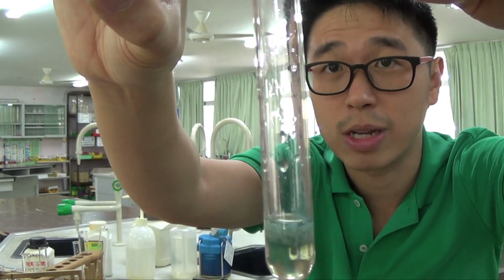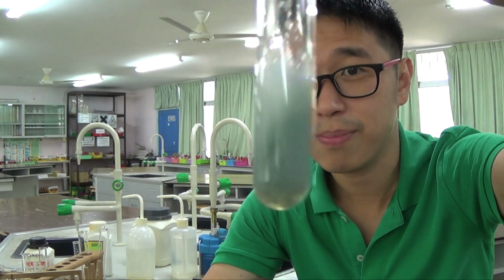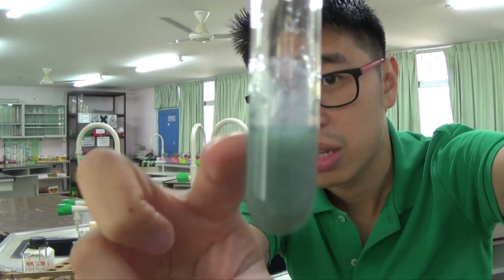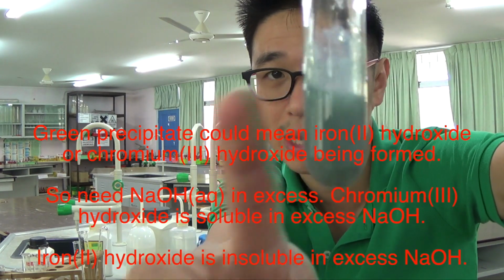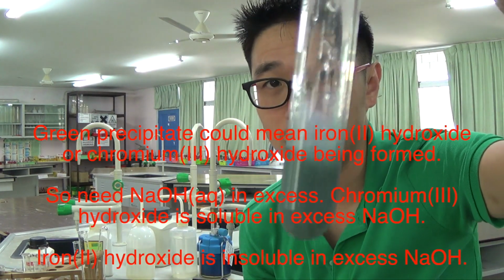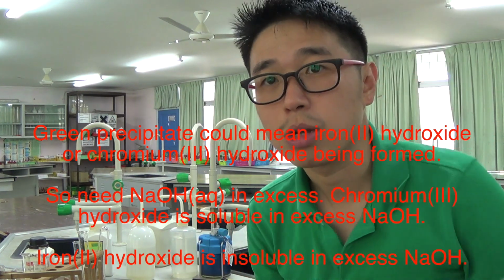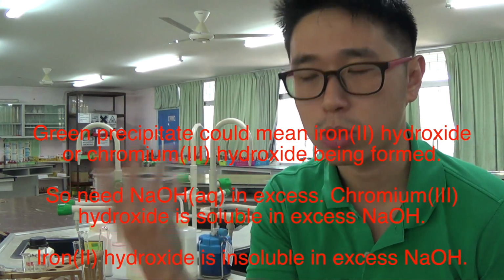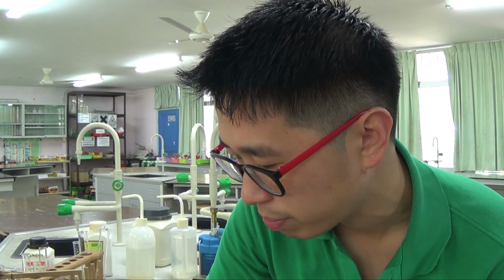Okay? So you should do it drop by drop and then you can see it. But I'm a professional, so I know what I'm doing. So you know what happens here. You get a green precipitate, like the color of my shirt, but a bit darker. Don't forget that a green or dark green precipitate with sodium hydroxide could also mean that it's chromium 3+. Okay, so you get a green precipitate. In fact, it's a dirty green precipitate.